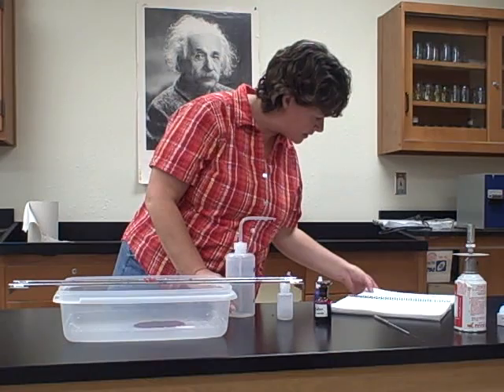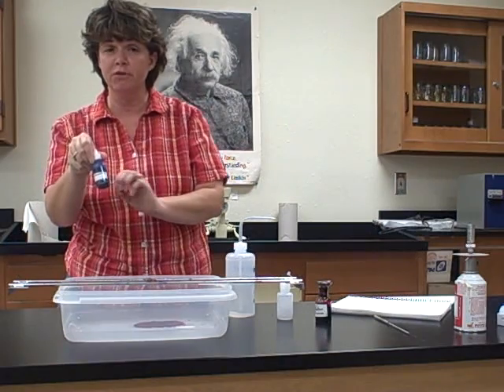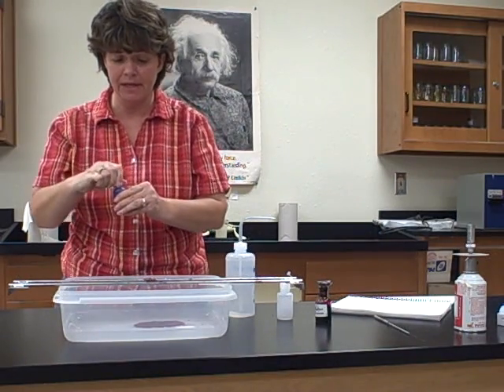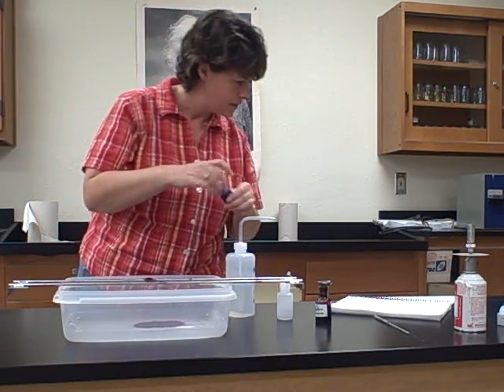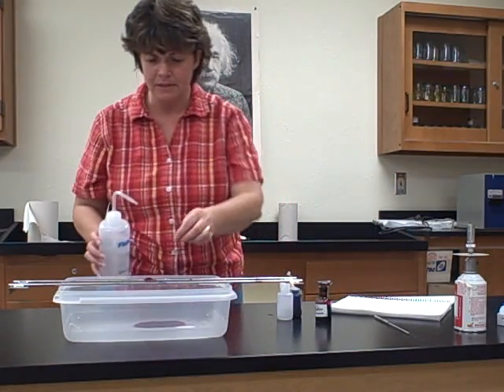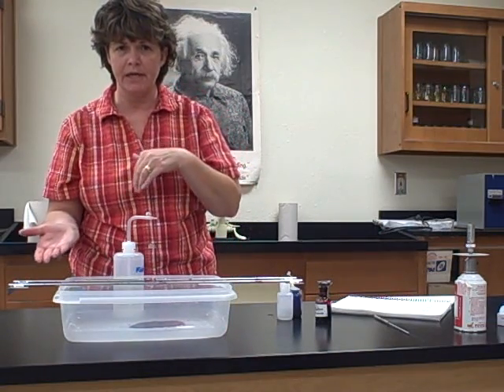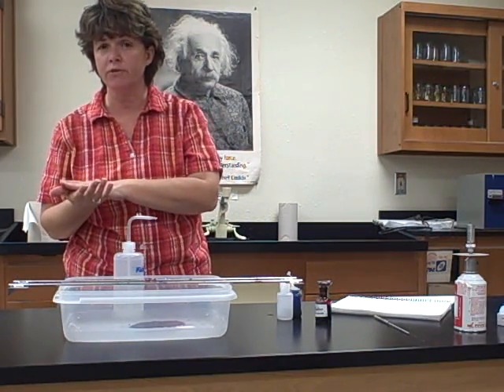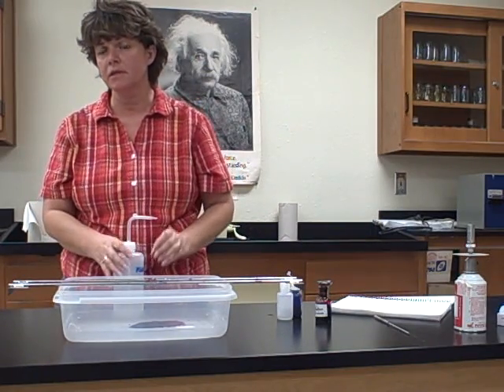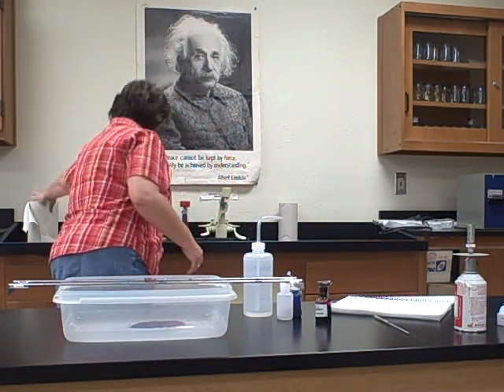Okay, and then the next is a counterstain with methylene blue. If you remember, we use methylene blue for our simple stain, so in this case it's going to be the counterstain. So you just put it on for 60 seconds, and after it's sat for 60 seconds, then we're going to rinse it off. So the actual procedure itself, putting on the primary stain, rinsing with water, doing the decolorizing, rinsing with water, and the counterstain is very similar to the gram stain. One thing that we don't put on this stain is a mordant like we did with the gram stain, which was the iodine.